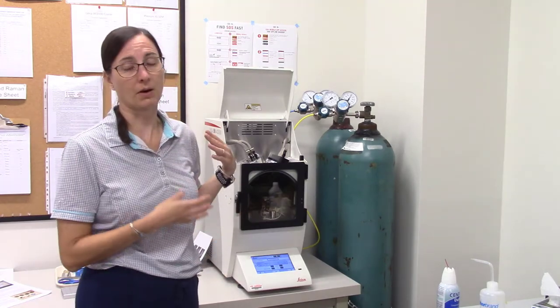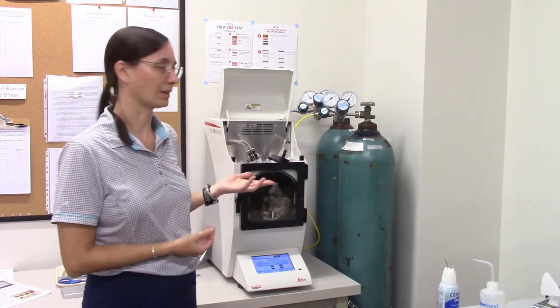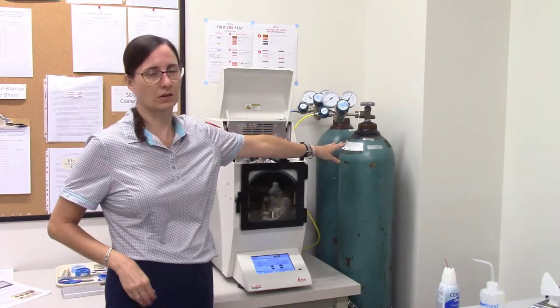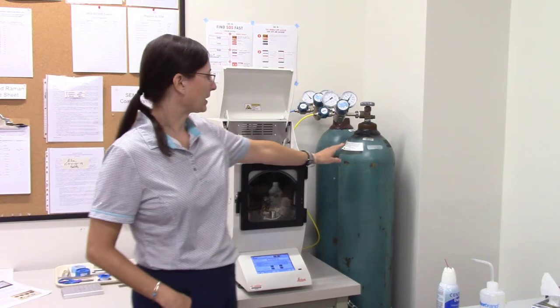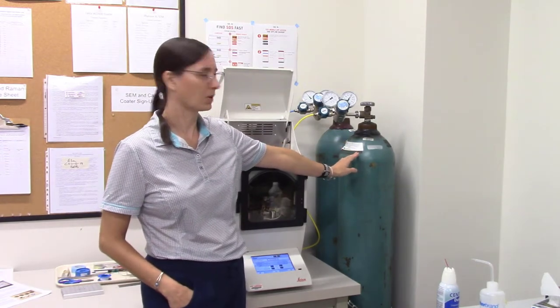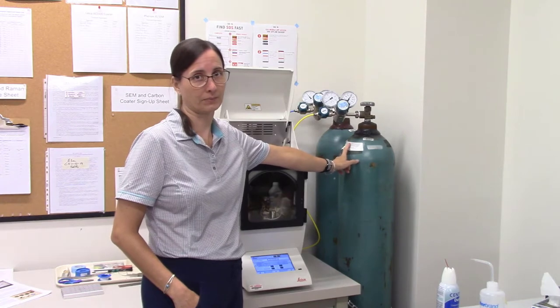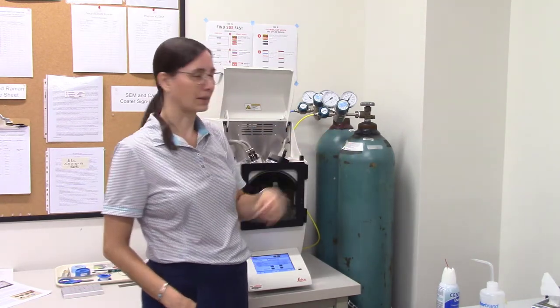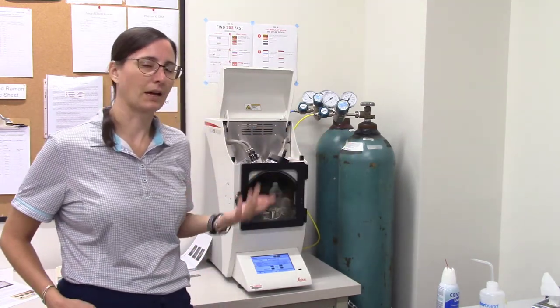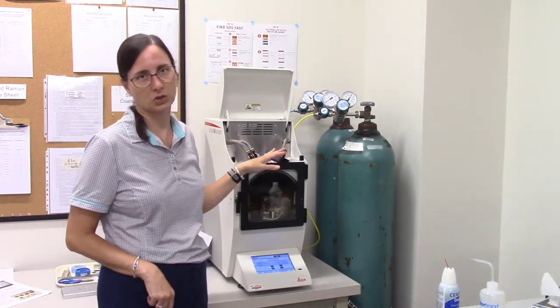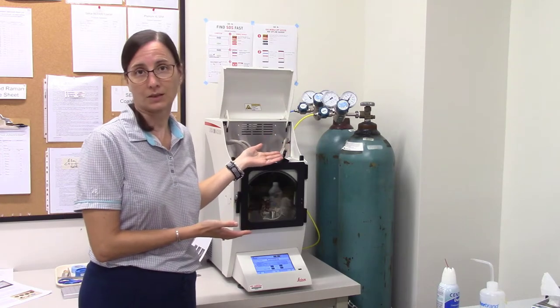We can talk more about each part in detail. You'll see there's two gas canisters over here. The only gas canister we'll use for carbon coating is nitrogen gas, which is the one on the front. You can double check by reading it. There's also a container of argon, but we don't need that for carbon coating, only for gold coating, which is the other type this instrument does.